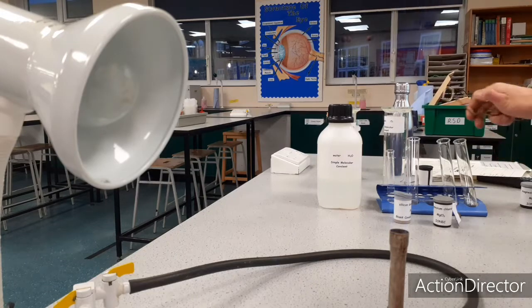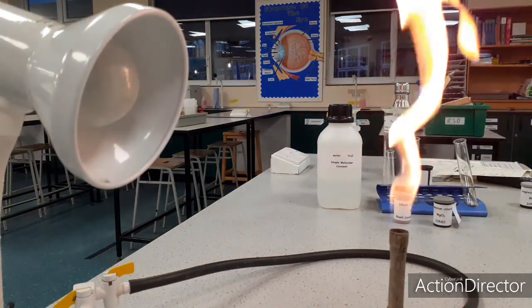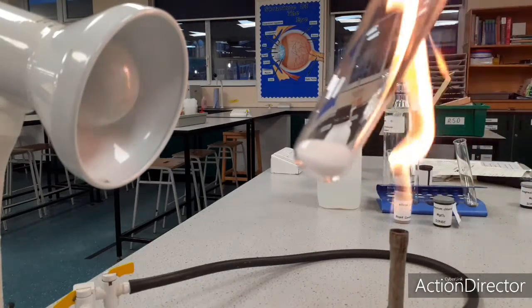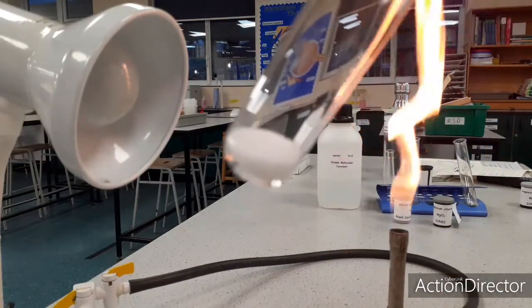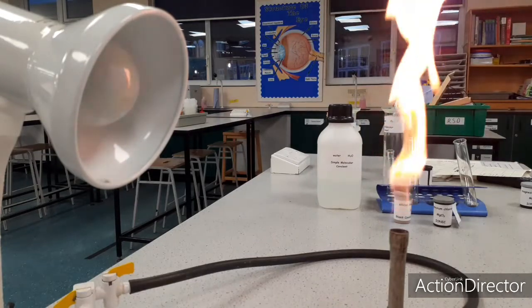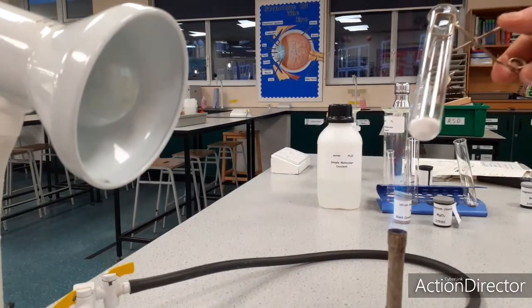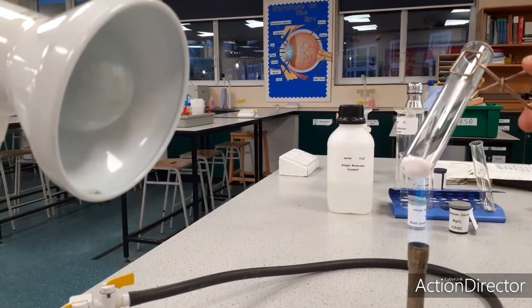Now for an ionic substance, so back to the safety flame for a second. The ionic substance I'm going to show you is, bring it into the frame, those white crystals of magnesium chloride with Mg2+ ions and Cl- ions. Just get a good secure grip, turn it onto a hot flame, open the air hole so I've got complete combustion.